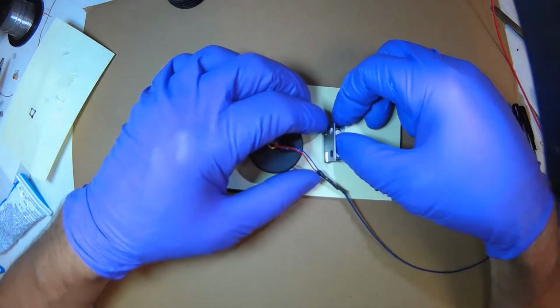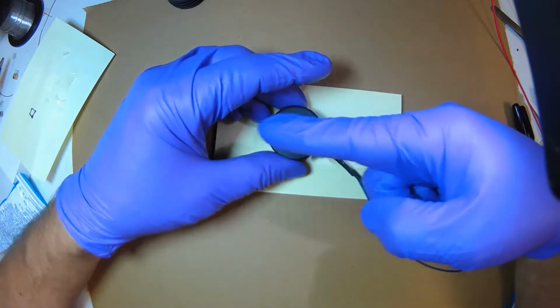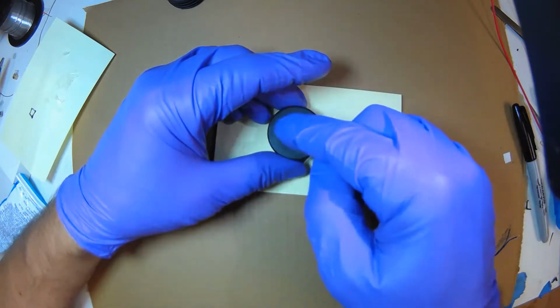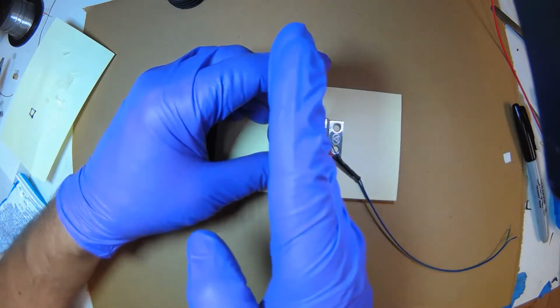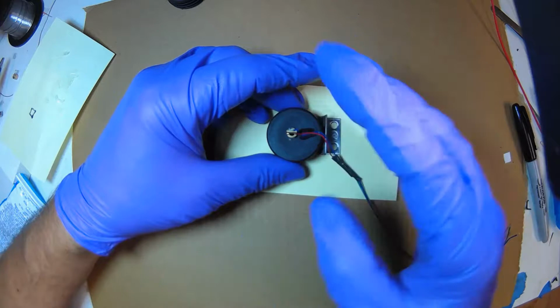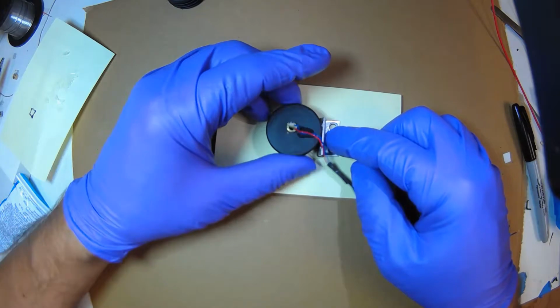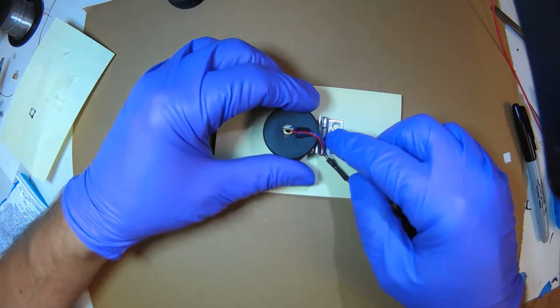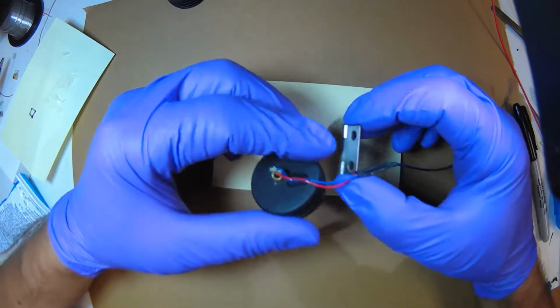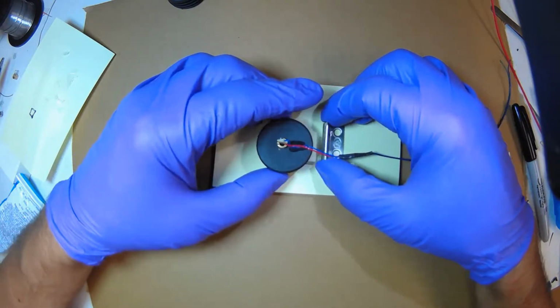Remember, you also want the circuit board to be perpendicular to the hinge, because the beam is perpendicular to the circuit board. So by orienting it this way, with the circuit board perpendicular to the hinge, the beam will be parallel to the hinge. Okay, we're going to put some hot glue on this, and then just a little bit to tack it in place.